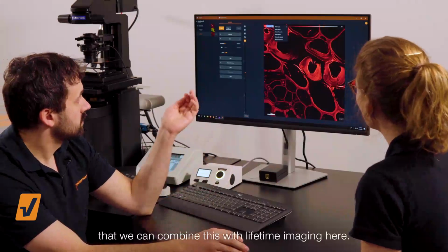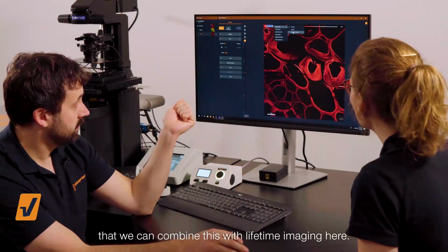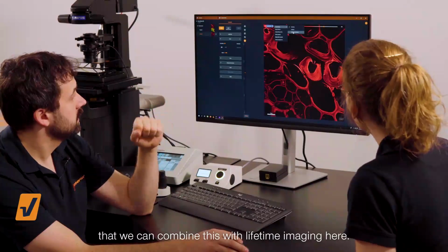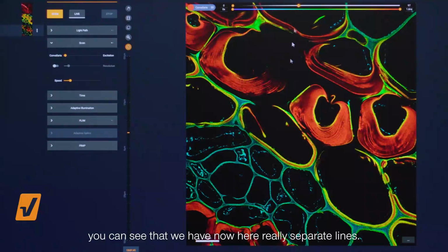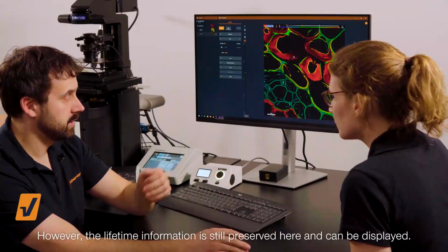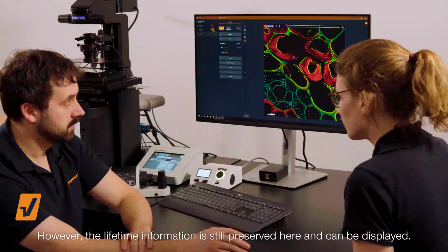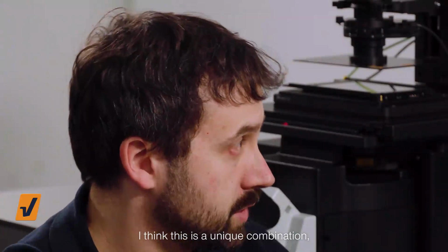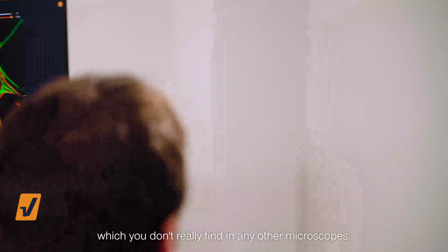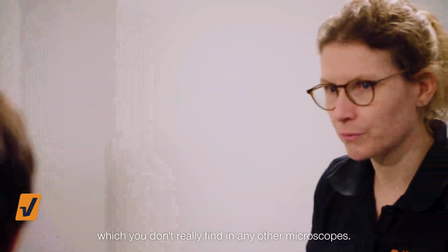What I would like to show as well is that we can combine this with lifetime imaging here. And if I make this brighter, you can see that we have now here really separate lines. However, the lifetime information is still preserved here and can be displayed. And I think this is a unique combination which you don't really find in any other microscopes.